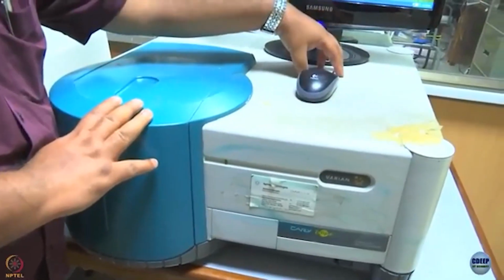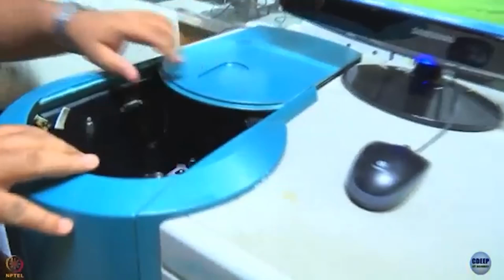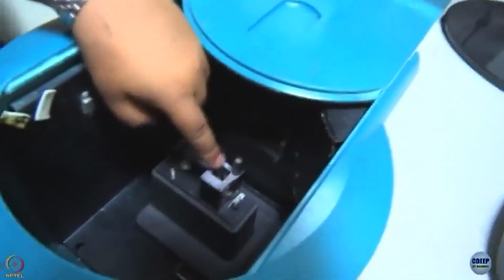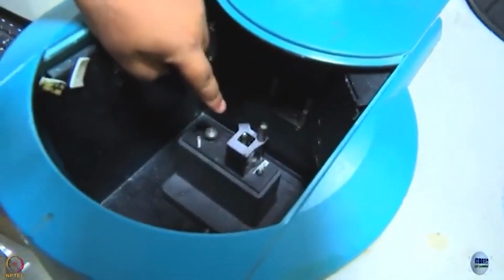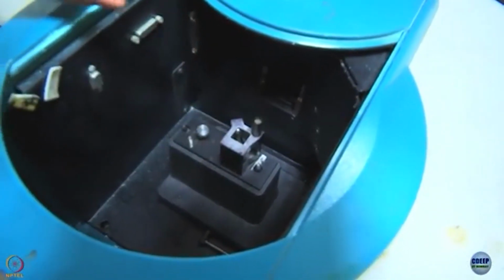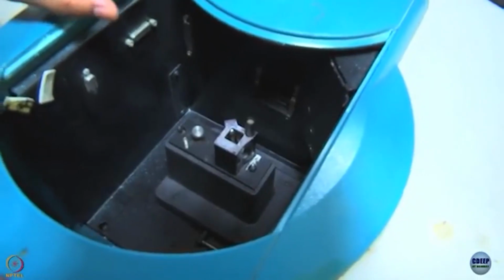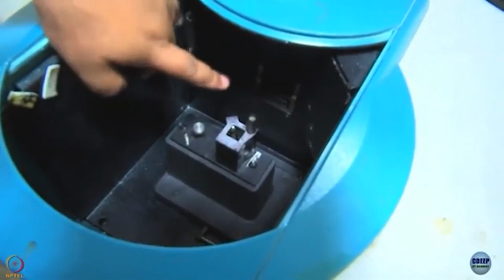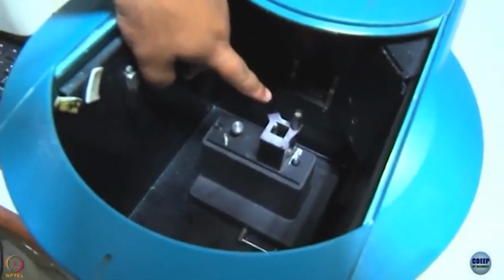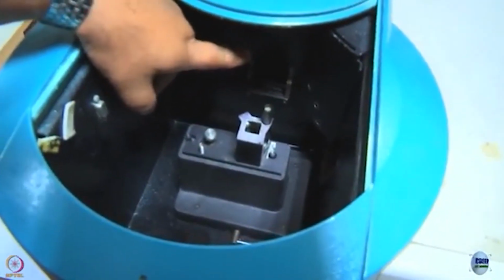This is approximately where the lamp is, this is where the monochromator is, and this is where you keep the sample. So, the light comes from this direction, it is focused at the center of this cuvette holder. Well, this glass vial in which we typically keep our sample, a glass or quartz vial, is called a cuvette, and as we said the last day, emission is recorded at 90 degrees. So, the detector is kept somewhere on the other side.